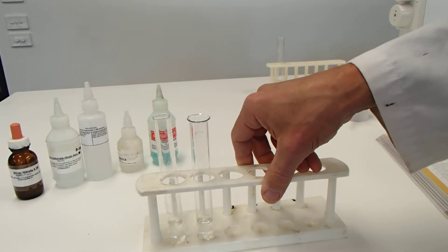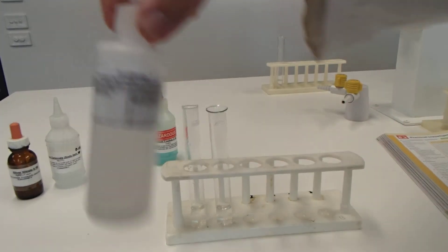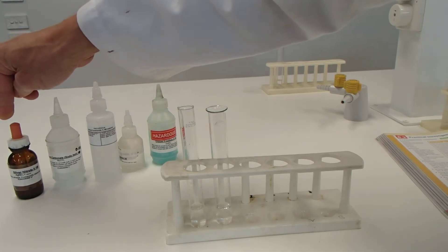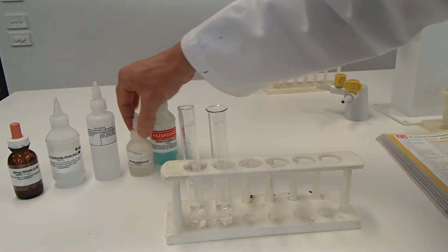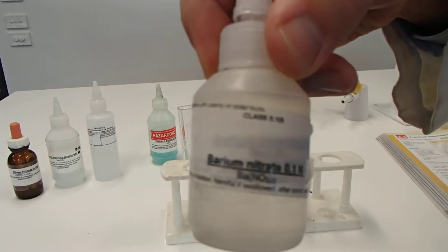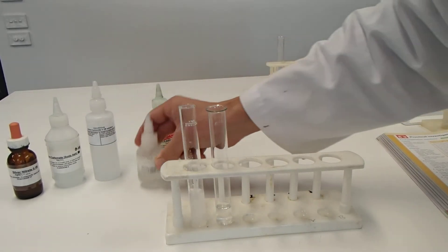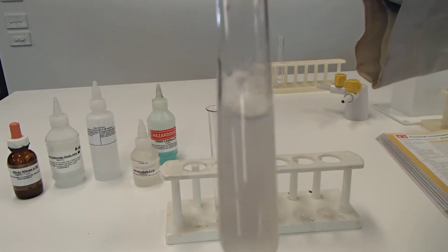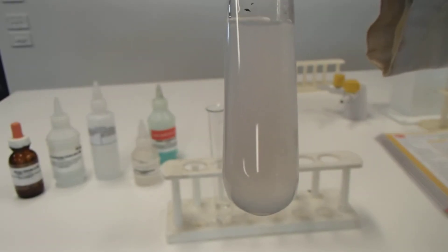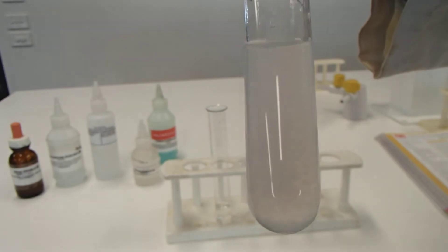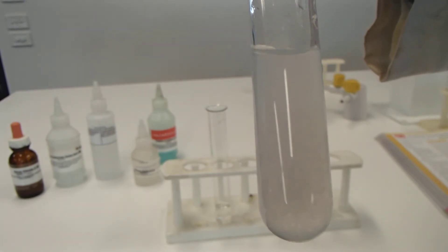Next set, we have the sodium hydroxide set. So here's the sodium hydroxide. Remember, I don't need to test sodium hydroxide against sodium carbonate or silver nitrate because we've already done those. So all I'll be adding it to is the barium nitrate. So here's sodium hydroxide and barium nitrate. That's interesting. I'll let you decide that one. Can you see through that? Can you see that test tube rack behind? Hmm. I can definitely see clouds and bits floating in that. Okay. It looks like solids to me.